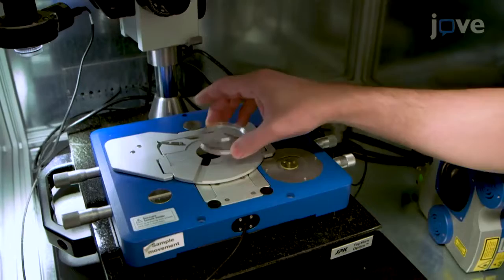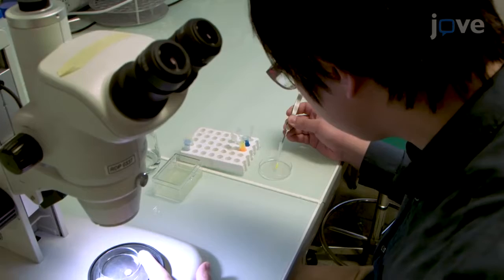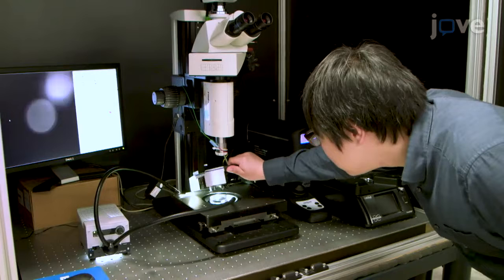For someone that is new to this procedure, fixation of the sample is really critical, so make sure that you really have a proper mechanical fixation of the sample.